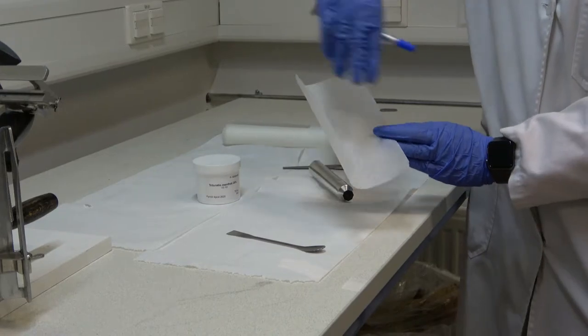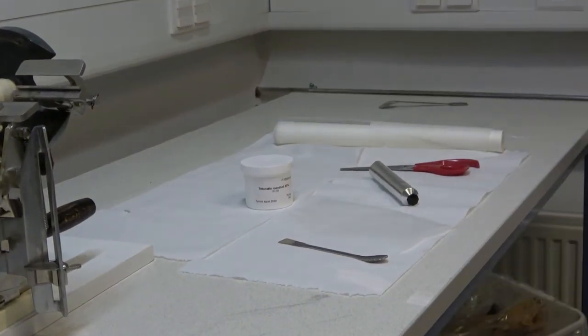The baking paper is then flipped to ensure that the lines traced will not contaminate the formulation made.